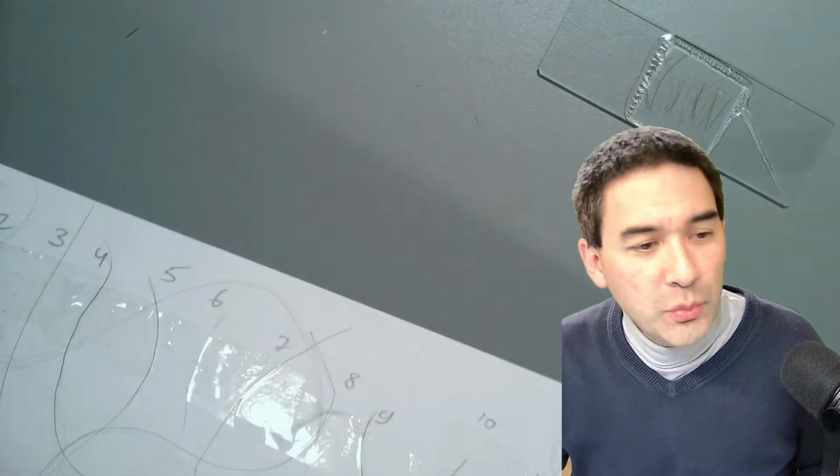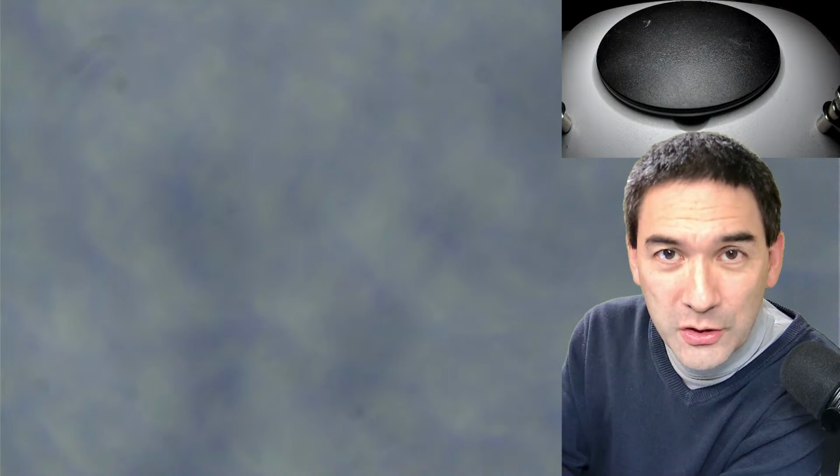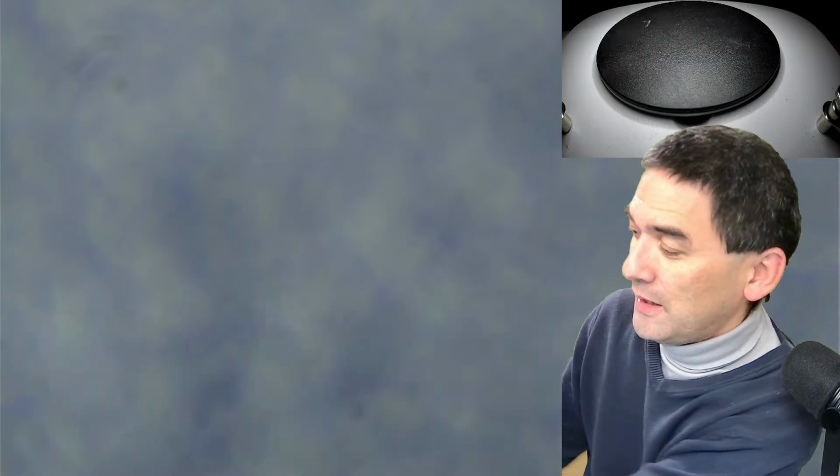What I would like to do now is quickly show it to you also under the stereo microscope, because one of the things that I want to do today, and that's the learning aspect of this live stream, is not just that we look at hair, but I also want to show you how to do some measurements under the microscope so that we can determine the diameter of a hair. And I would like to also show you the diameter of a hair in relation to some onion cells. And I'm now placing this here under the stereo microscope.